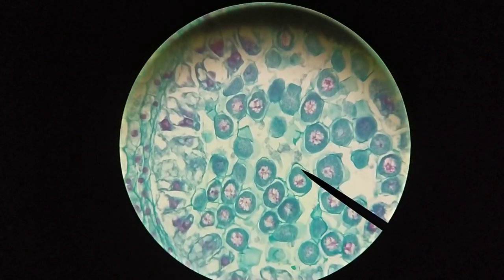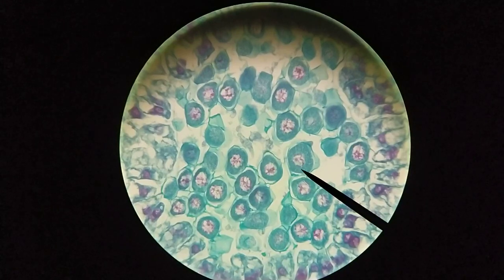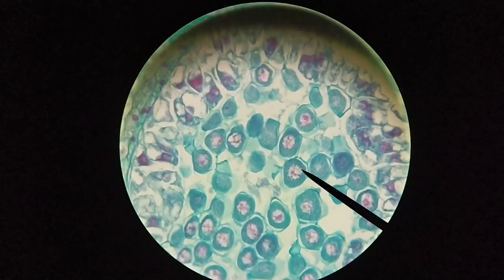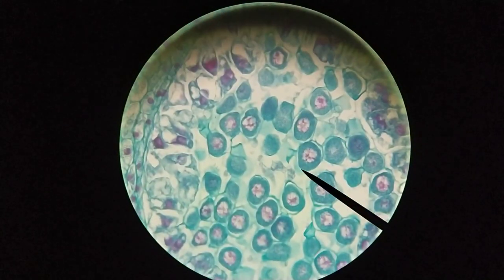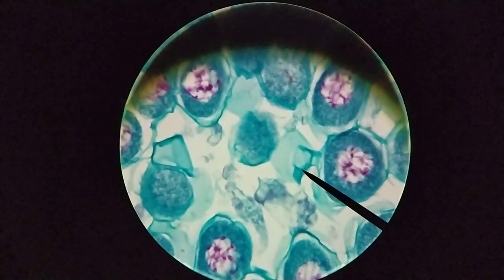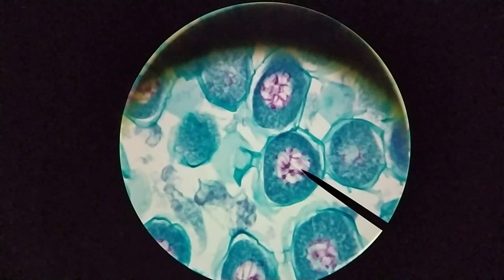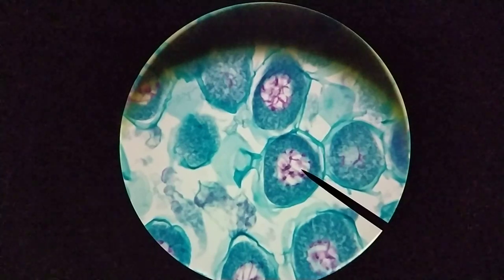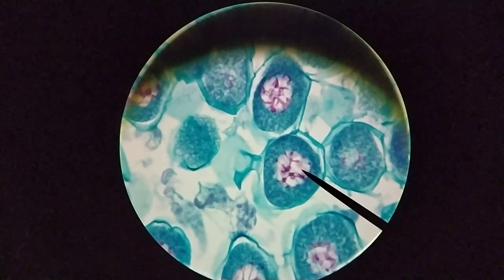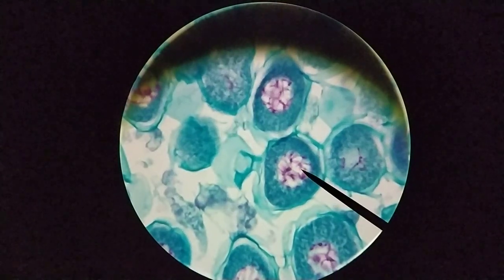We're starting to see some detail here. You can see these rounded cells — these are the microsporocytes. These rounded green cells have a nucleus inside, which looks fairly pale in this case, and the chromosomes look like a pink or red color. All of these cells basically look the same. Looking at one of these cells in detail, you can see relatively thick strands. This is a fairly late stage of prophase I — likely pachytene or diplotene. They're not fully condensed yet, so we don't see the fully condensed short chromosomes, but we are getting to that point. Crossing over has likely happened at this point.